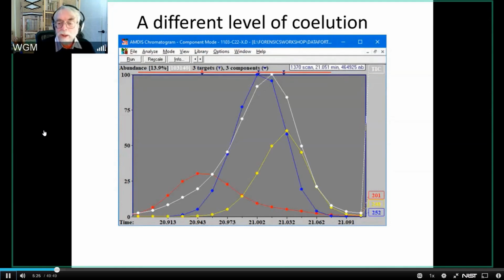And when you look at the individual ion chromatograms, and I've pulled 3 of them up here, you see that there's a 201 that peaks very early. There's a 252 that's larger and peaking a little bit later. And there's a 248 that's peaking a little bit later. So within this manifold that looks at first glance like a single peak, there are in fact 3 distinct components.